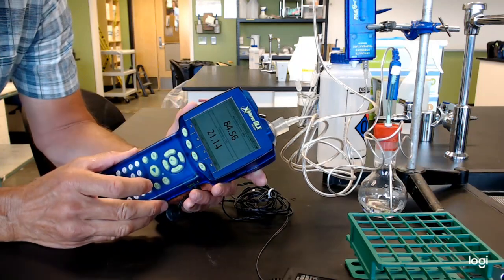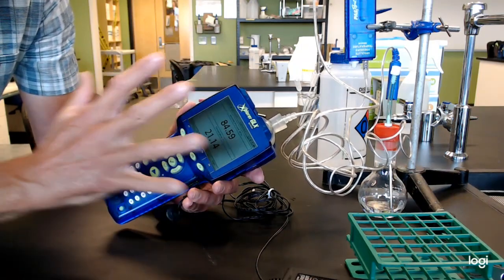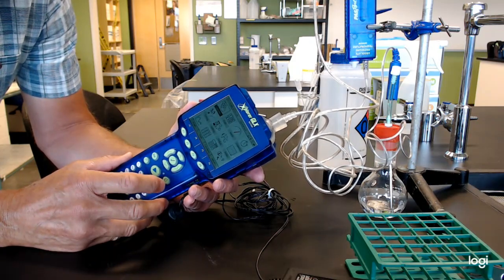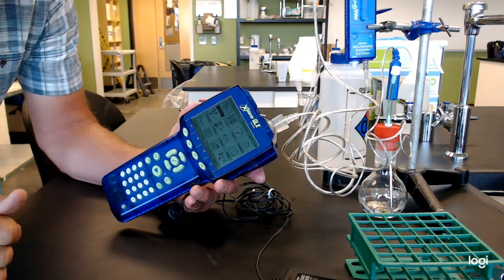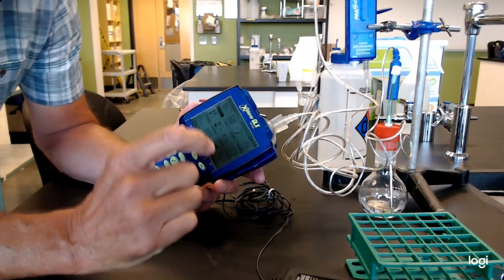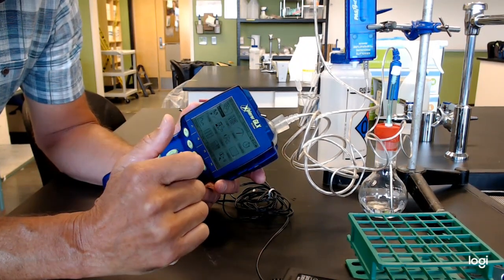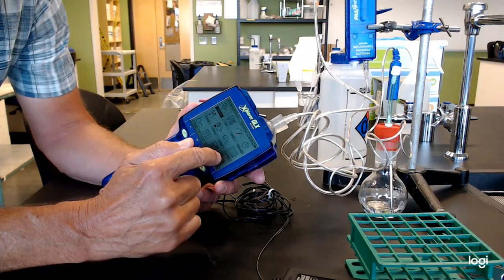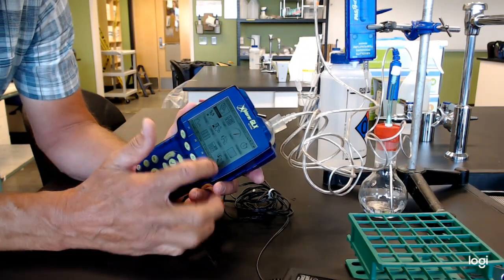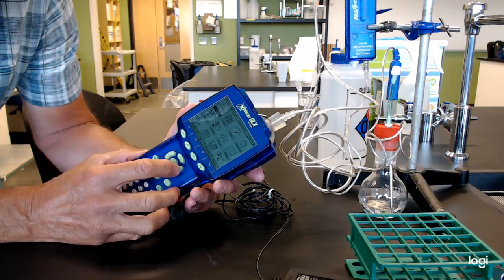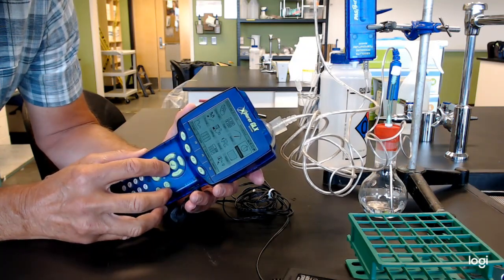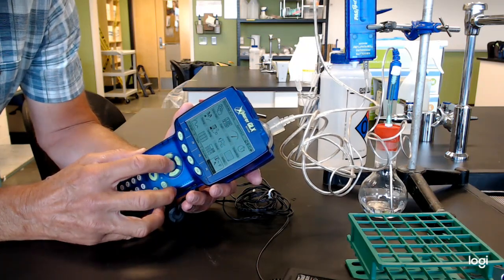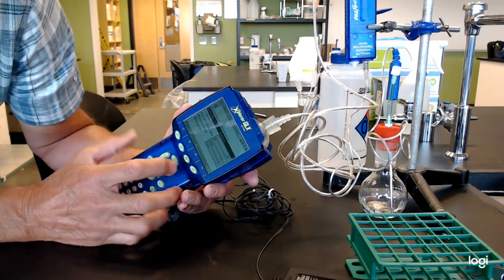Then generally speaking, as you're walking around the design of this data logger, home screen gets you to all the menus that this data logger has access to. If you want to look at your sensors and do any changing on the sensors, it's in the bottom right-hand side. So you arrow over, arrow down, and then once you select, it'll open up that box.